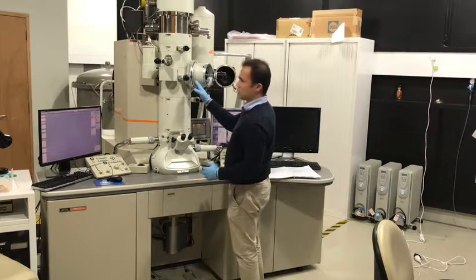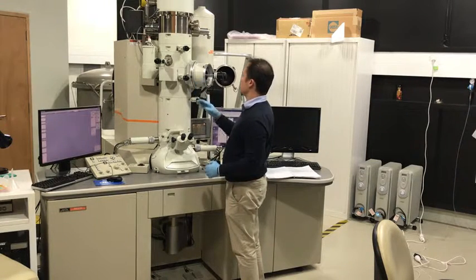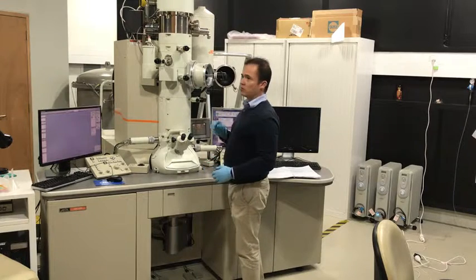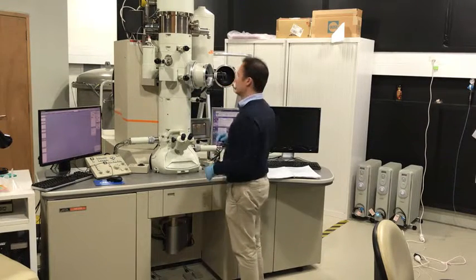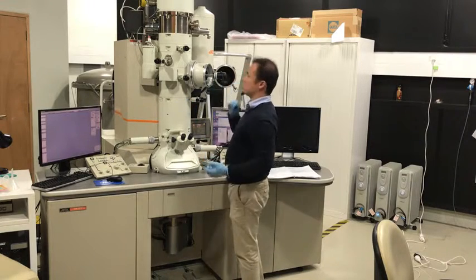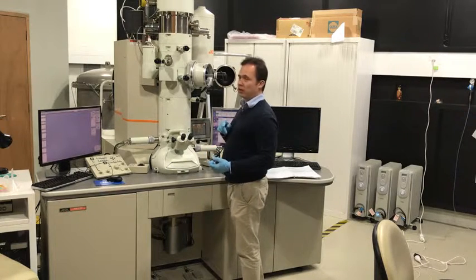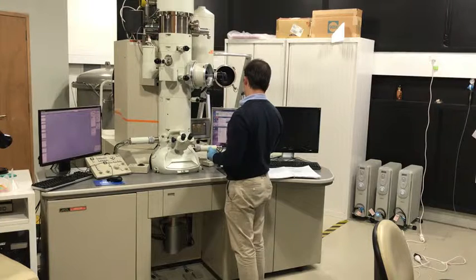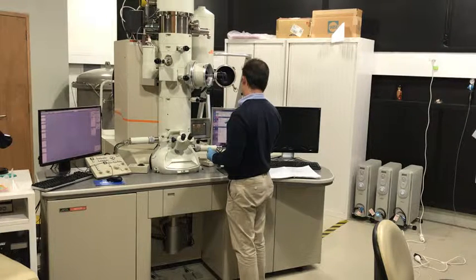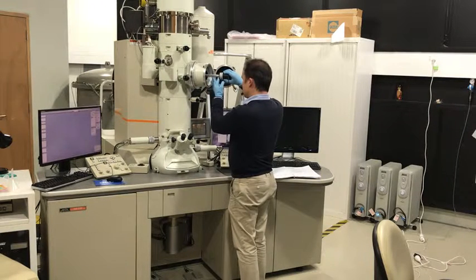And it's allowing the airlock to come up to atmospheric pressure so that I can remove it without air rushing in. Because if the airlock is still under vacuum, air will rush in as I try to pull this out, and it'll also be exceedingly difficult to pull it out against the pressure of the atmosphere. So now it's finished pumping nitrogen into the airlock. I can easily remove it.